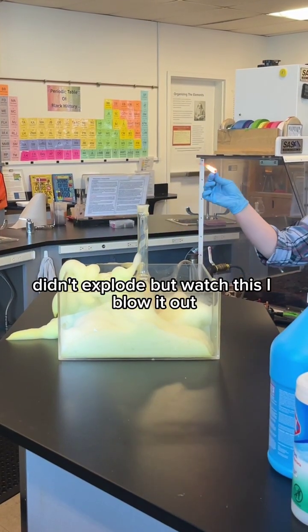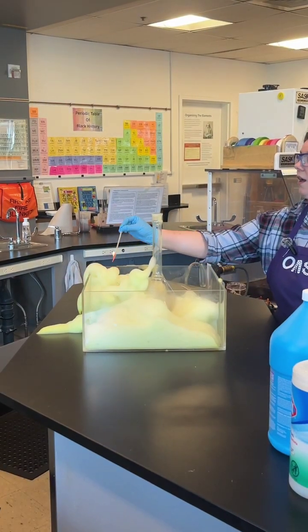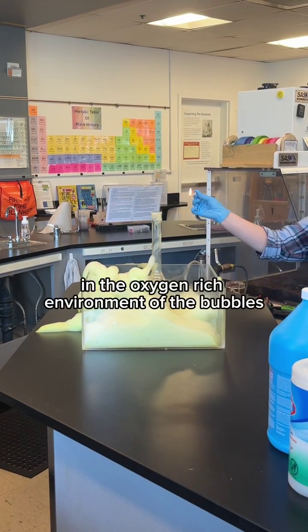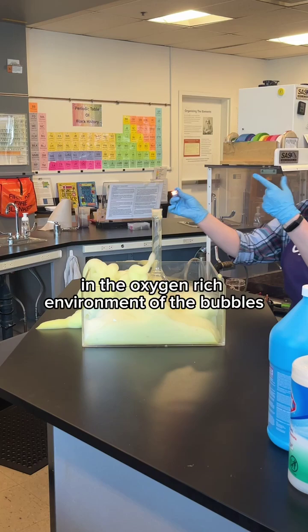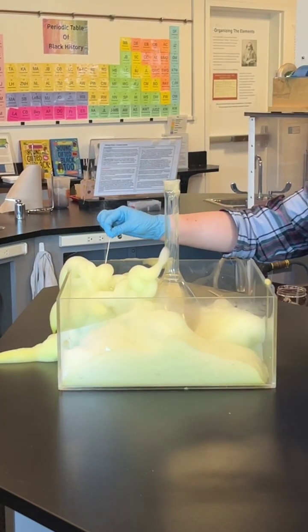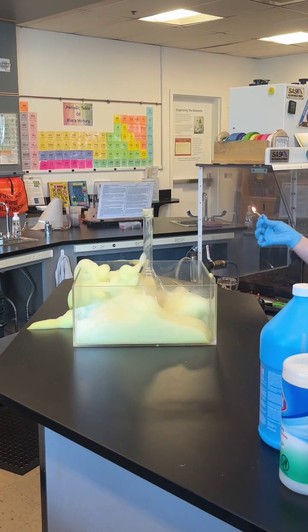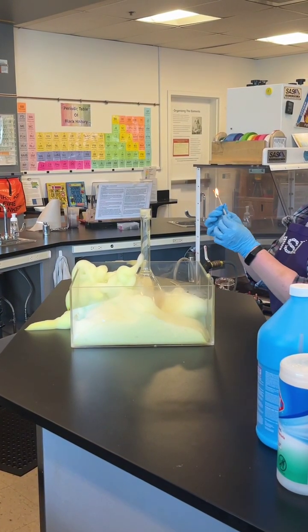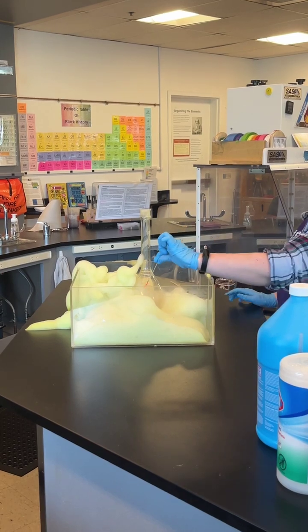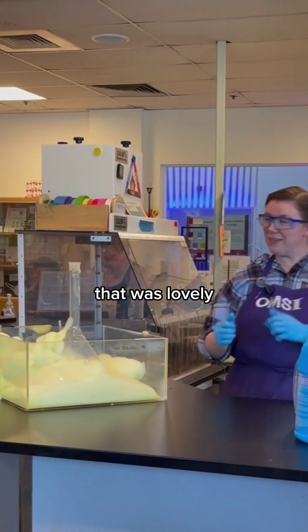Didn't explode, but watch this. If I blow it out, in the oxygen-rich environment of the bubbles, we can reignite the flame. Do it again. In another part? Okay. That was lovely.